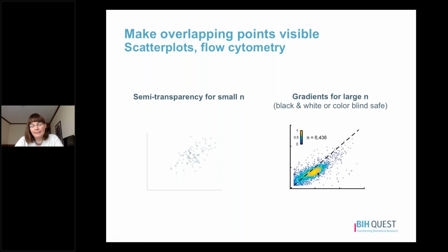So in this case, you either want to have a black and white gradient or a color gradient. You can either show the data points in your gradient colors with a scale showing what those values represent, or you could have grid lines like you might see on a topography map showing elevation. And those grid lines would show the density of data points within that region or space.